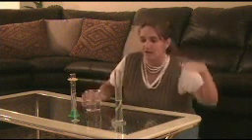So let's take a look. To read this graduated cylinder, we just count. Here's 80, 81, 82, 83, and 84. So we know now that there's 84 milliliters in this graduated cylinder. Well, that's how to find the volume of liquid.